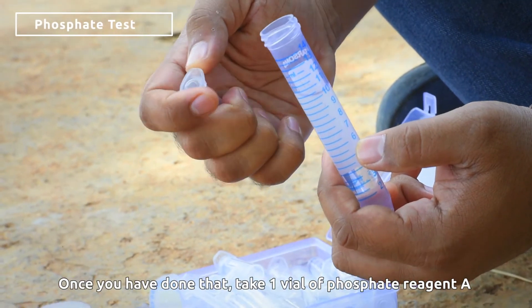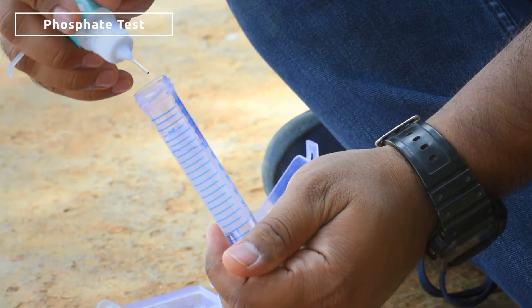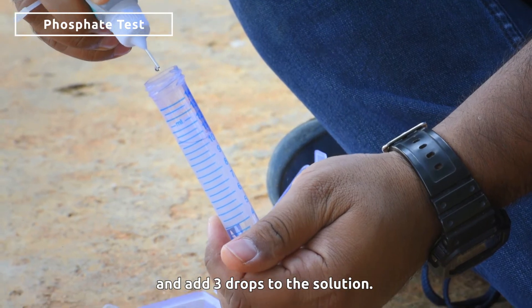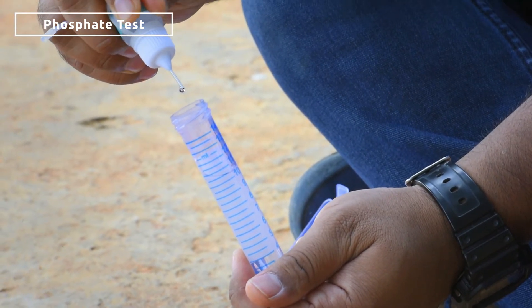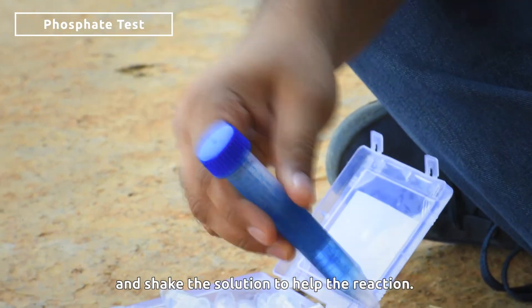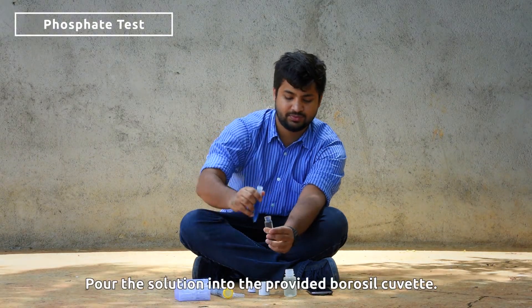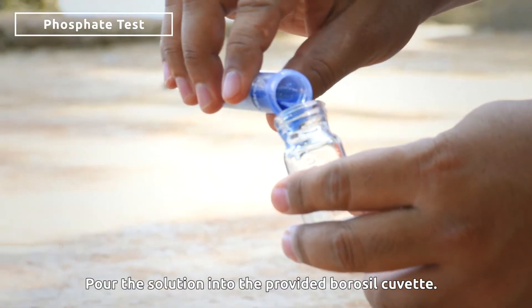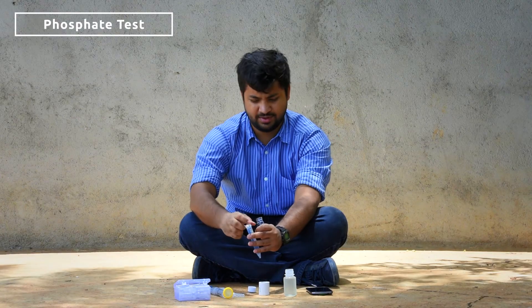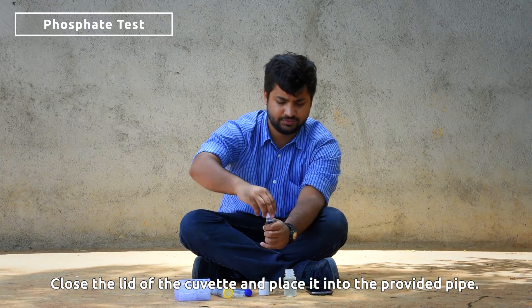Take 1 vial of phosphate reagent A and add it to the sample. Take the dropper of phosphate reagent B and add 3 drops to the solution. Close the lid of the measuring chamber and shake the solution to help the reaction. Pour the solution into the provided borosil cuvette. Close the lid of the cuvette and place it into the provided pipe.